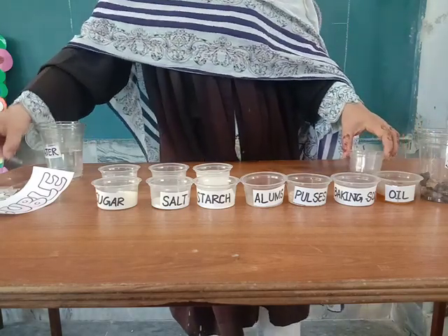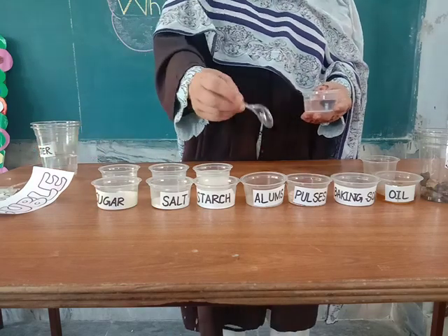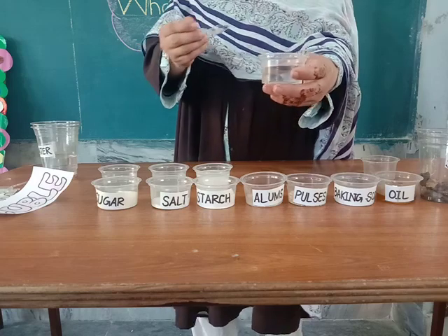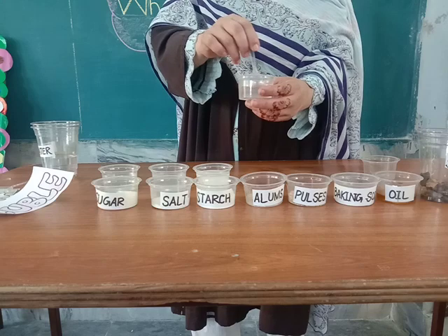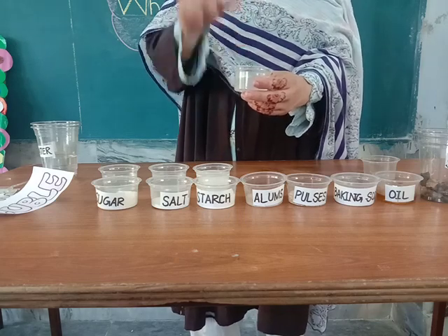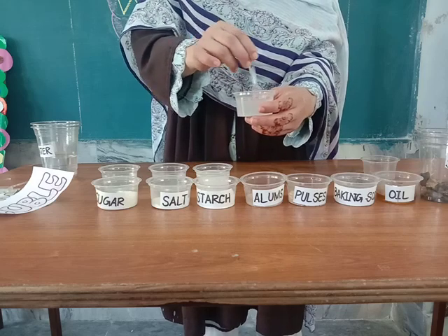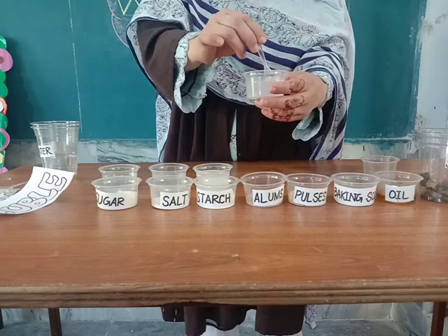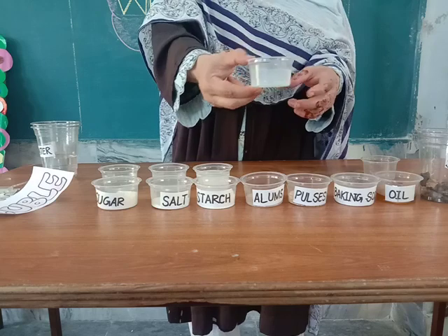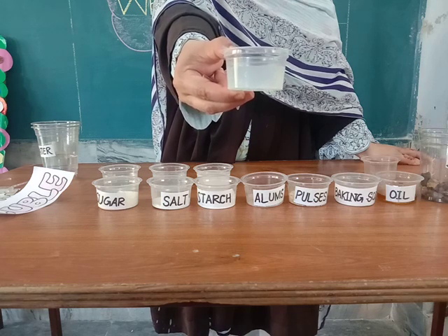Next we have alum, which is called phtkari. We will test that it will dissolve in water or not. I take a little amount of alum and dissolve it in water, stirring it for at least 30 seconds. Alum has many uses — it is a very useful substance. Now if you look at it, it has completely disappeared, which means that alum is soluble in water.